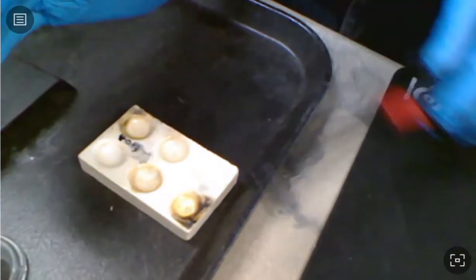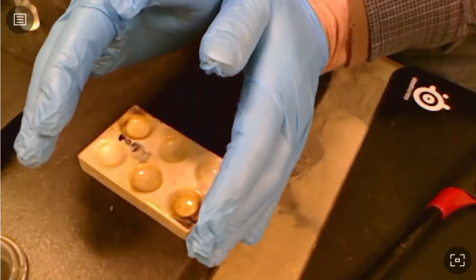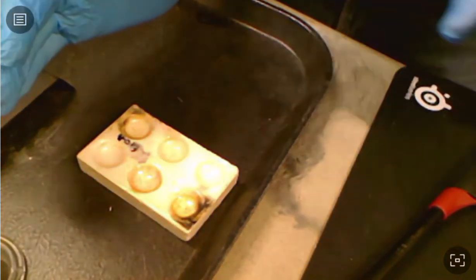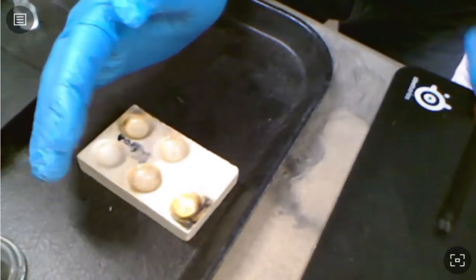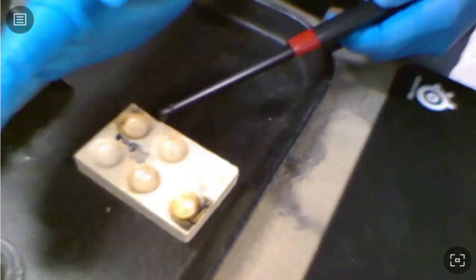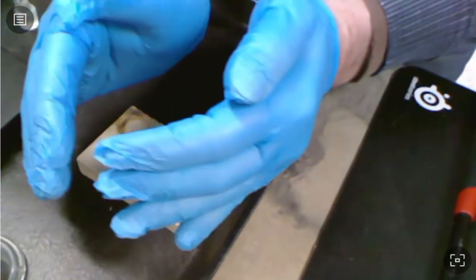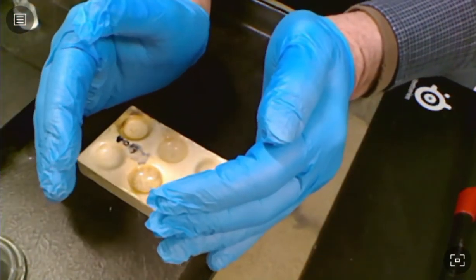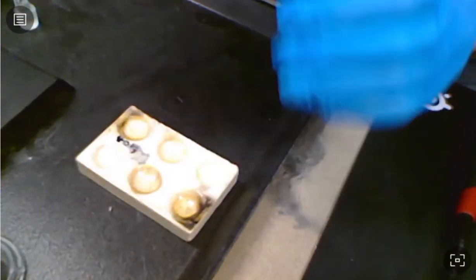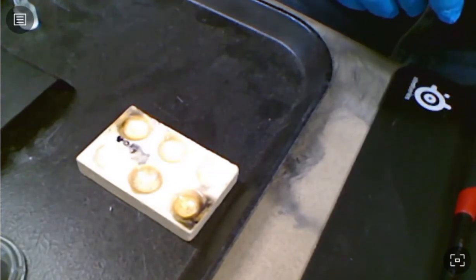When I ignite it this time, I'll try to shield it so that it doesn't seem so shiny, but it's impossible to see. Well, she's finally burning really well, but I don't see any flame at all visually, but with my hands around that, I feel it. So there's no doubt about whether there's a flame there.